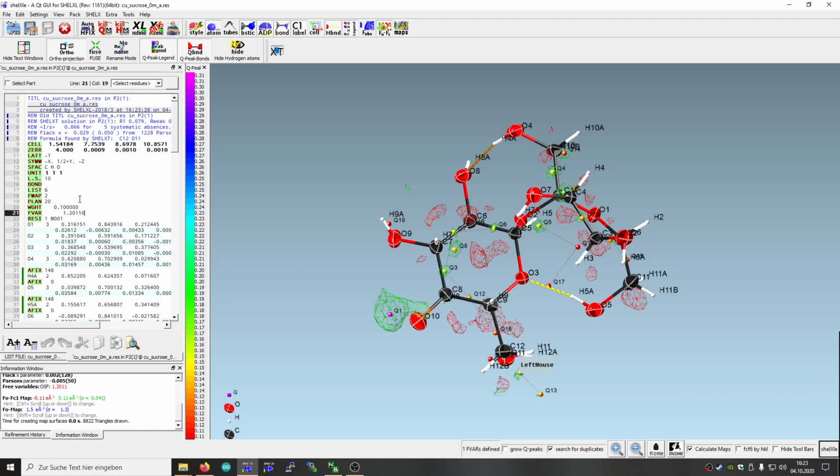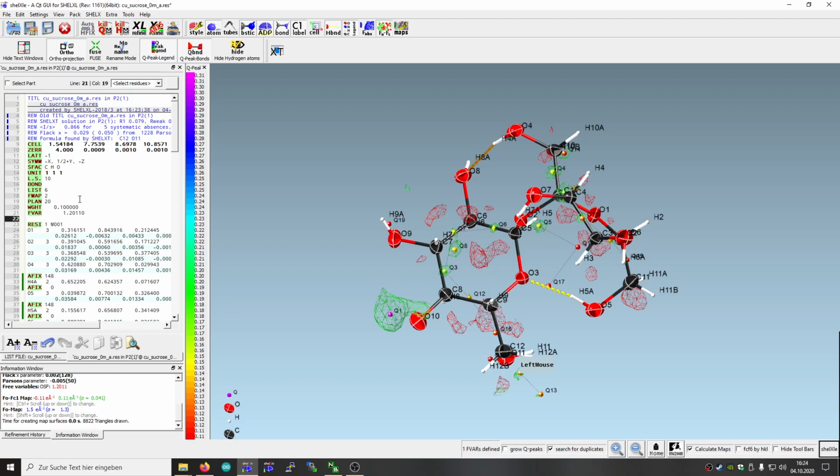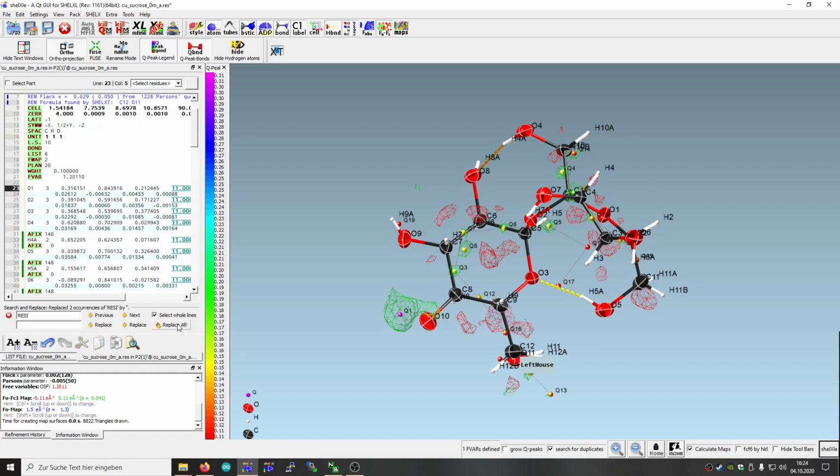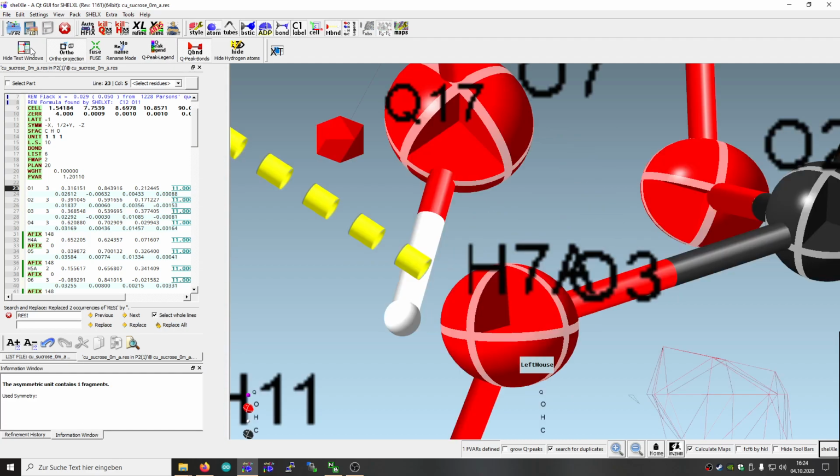Should have worked because of the resi, so we don't need the resi here. So let's remove that resi thing. Resi, select whole lines, and we replace them. So there's no resi left. So let's do that again.